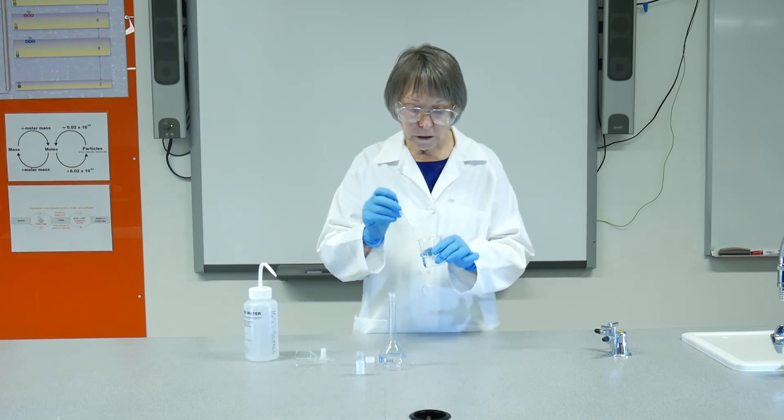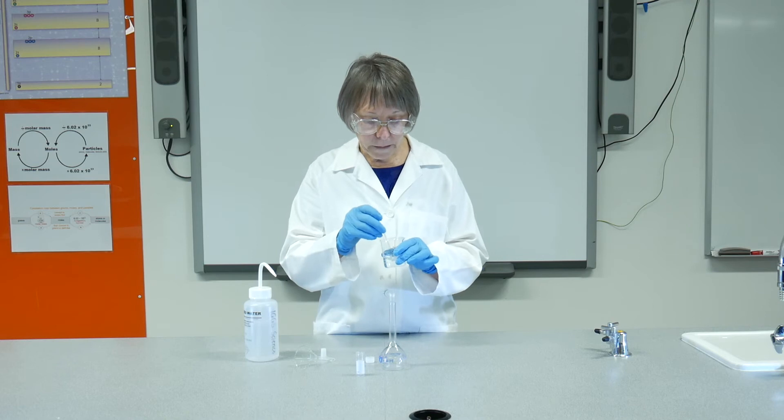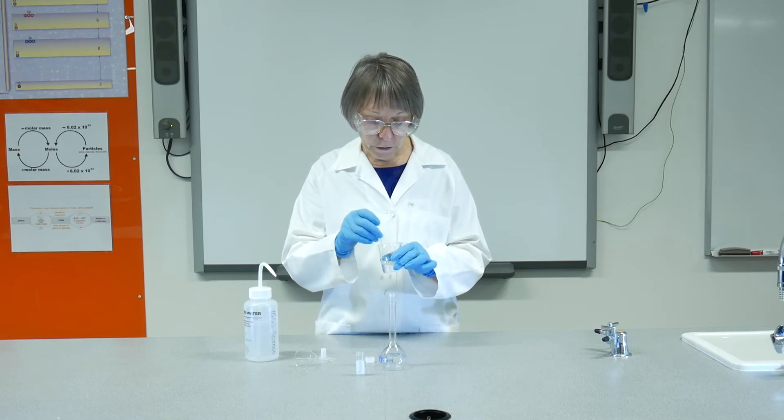And now to dissolve it, you need to make sure it's dissolved completely before we transfer it to the flask.